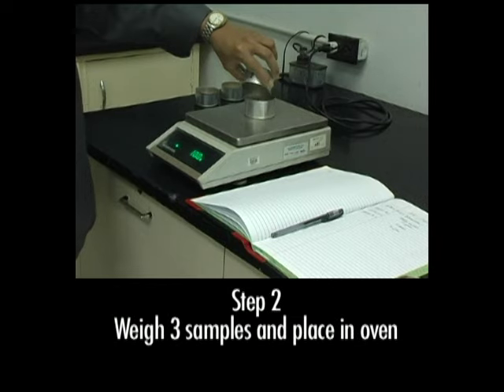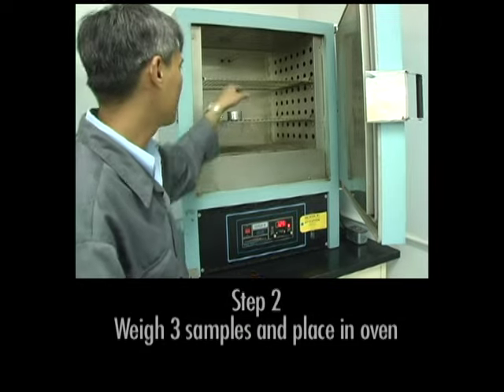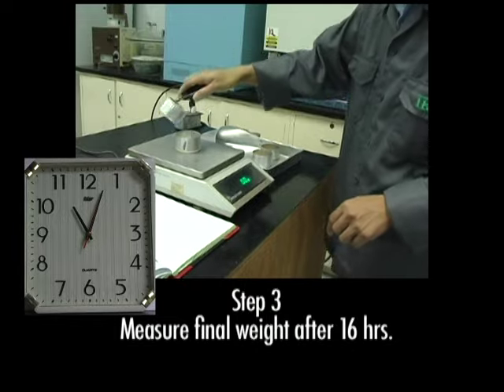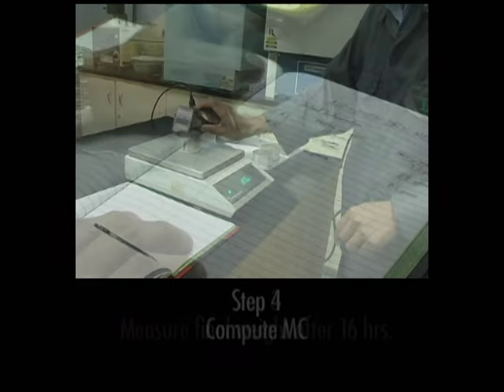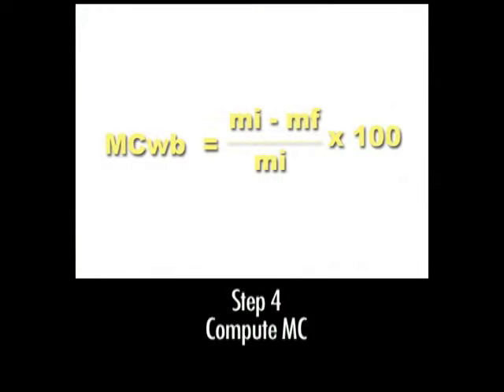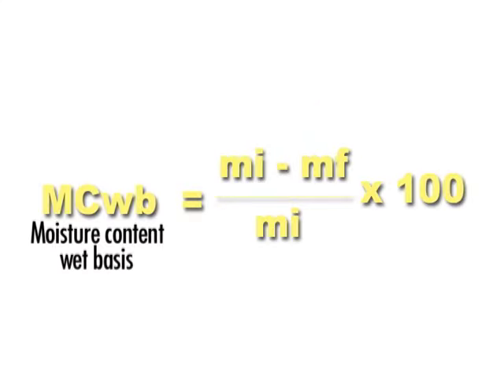Step 2. Weigh 3 paddy samples and place them inside the oven. Step 3. Measure the final weight of the samples after 16 hours. Step 4. Compute the moisture content wet basis using this equation. Moisture content wet basis equals the initial weight of the paddy minus the final weight of the paddy, divided by the initial weight of the paddy, and then multiplied by 100 to get the moisture content wet basis for those samples.